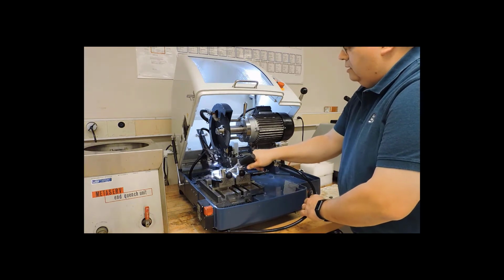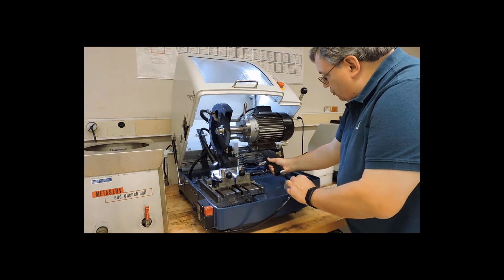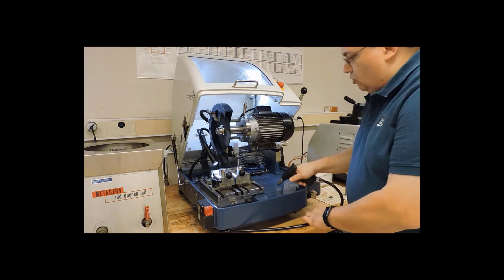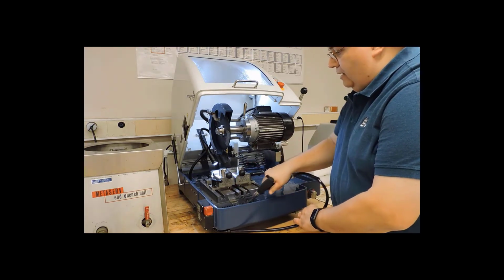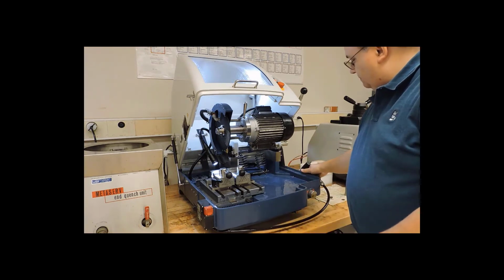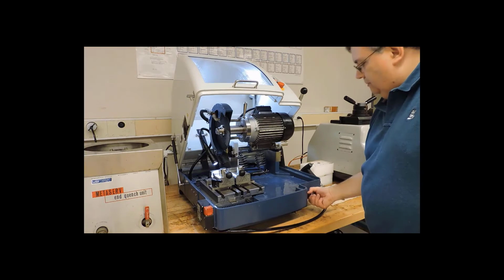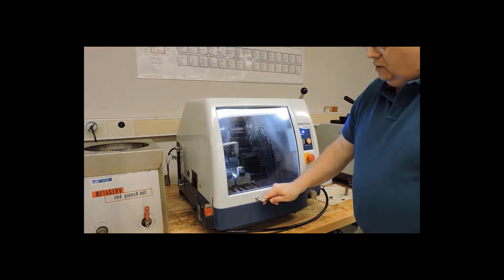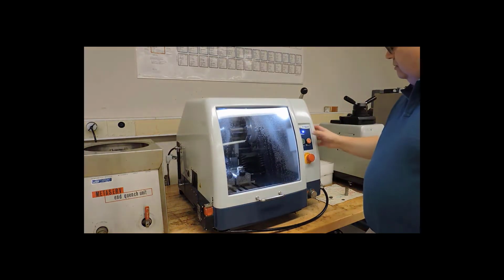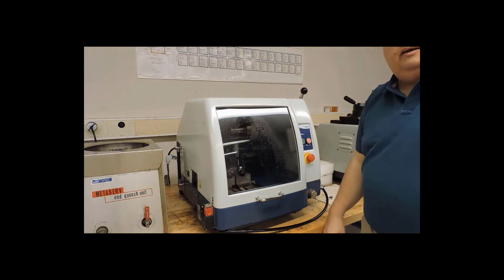because it's an abrasive blade, and so we get a lot of residue as the blade wears away. And we just want to flush all of that to the back of the chamber. When I'm done, make sure that I return that knob to the blade position, lower the hood back down, and turn the power off on the right-hand side.